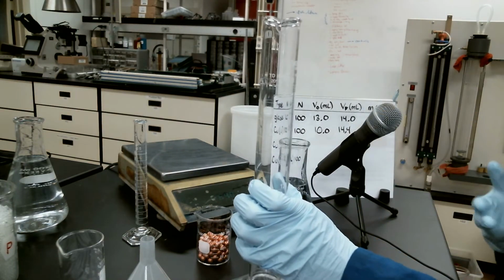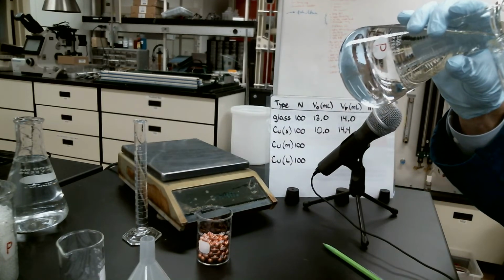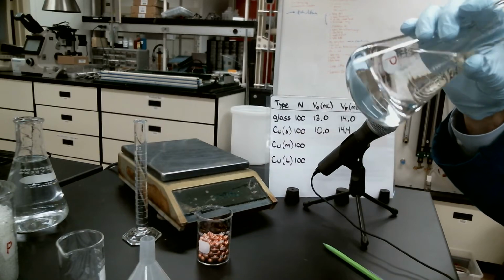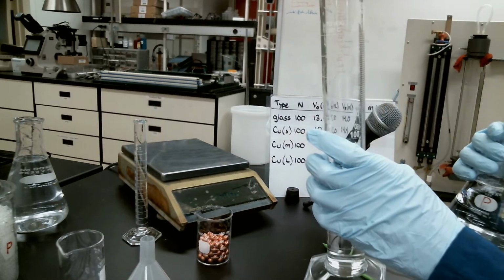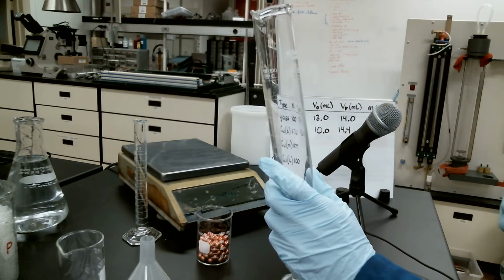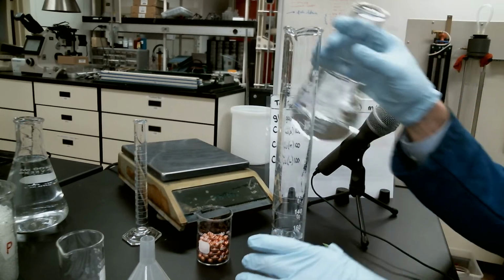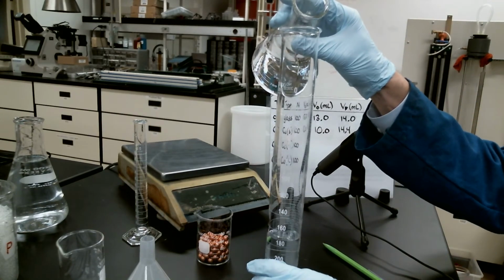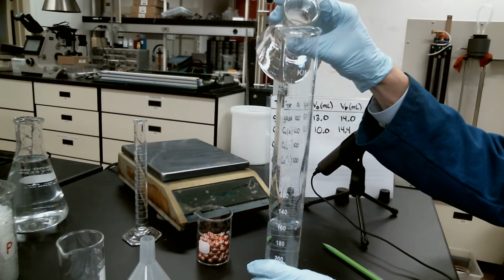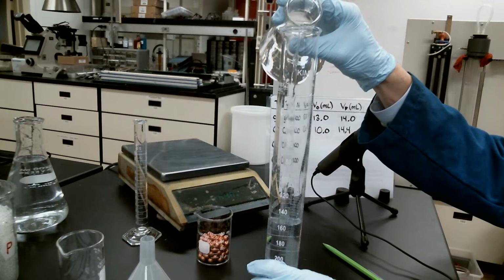So this has actually been calibrated by the company to be a little bit less accurate than just plus or minus half of the smallest measurement. Yeah, because the smallest measurement is 2 milliliters. Half of that would be 1 milliliter. The tolerance of plus or minus 1.4 is saying it's actually a little bit less accurate than what we would initially assume. So I'm going to try to get this fella right up to about 100 mils.